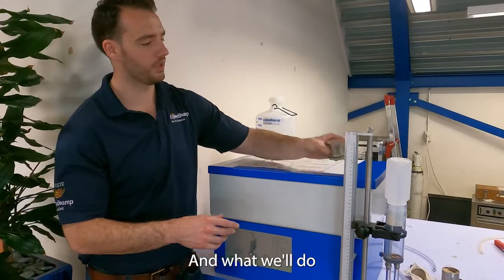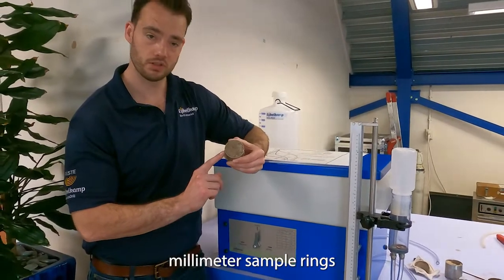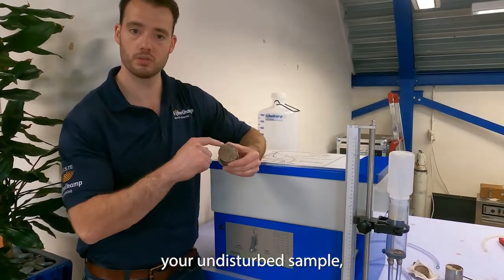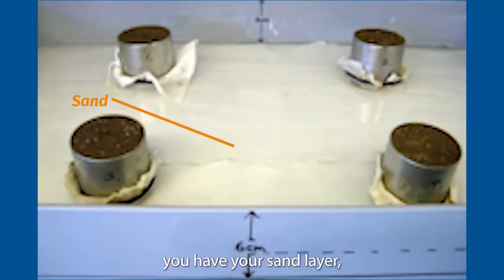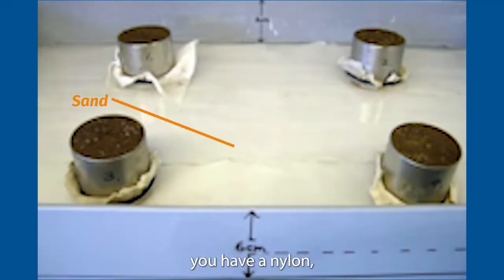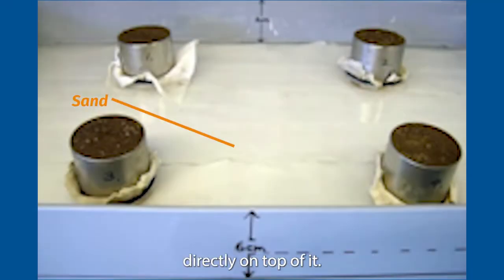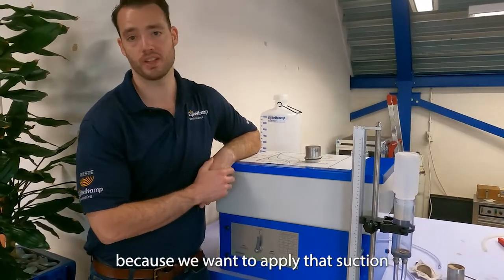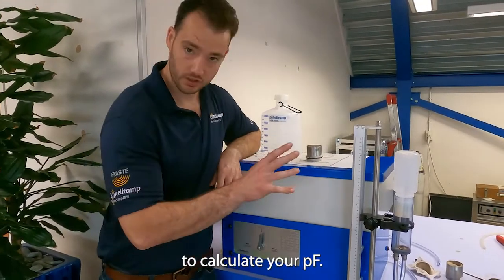What you'll do is actually take our 53-millimeter sample rings where you've grabbed your undisturbed sample. You have your sand layer, you have a nylon, and you'll actually be able to place it directly on top of it. We do this because we want to apply that suction to calculate your PF.